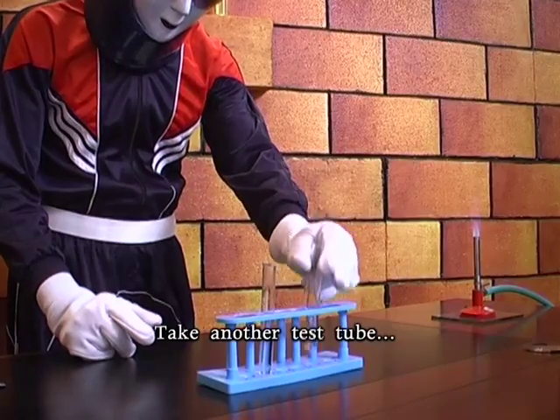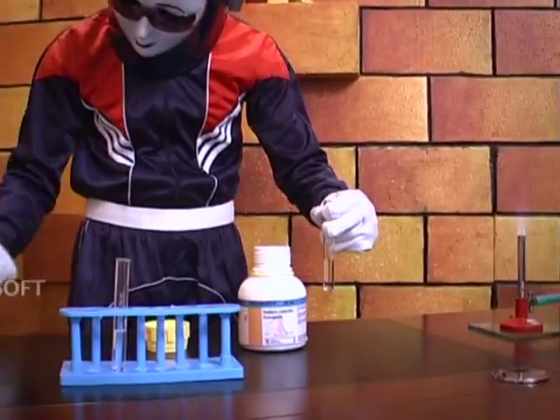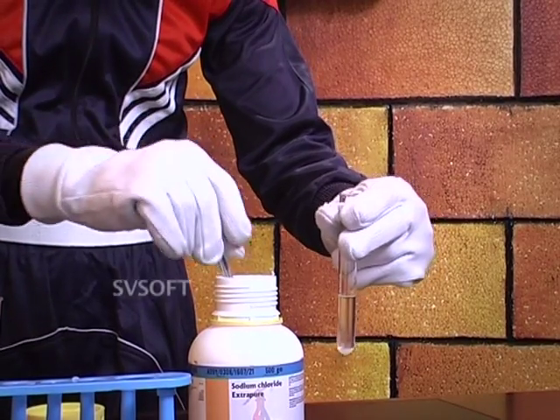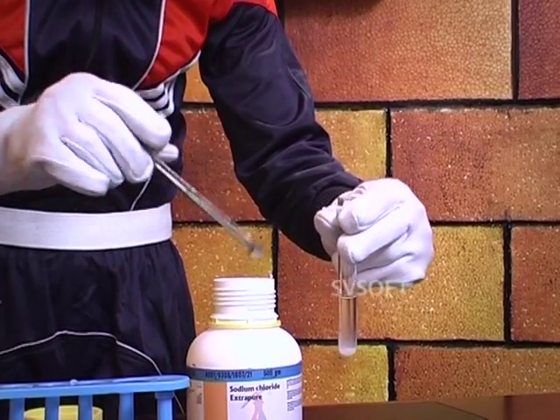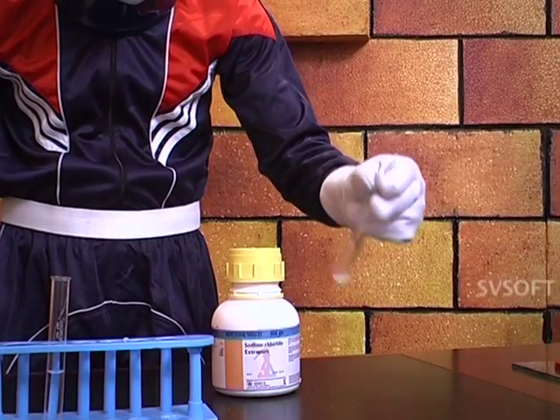Take another test tube. With a spatula, add salt to it. And shake it well.